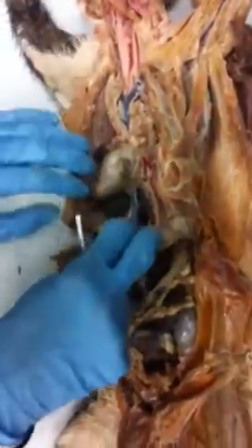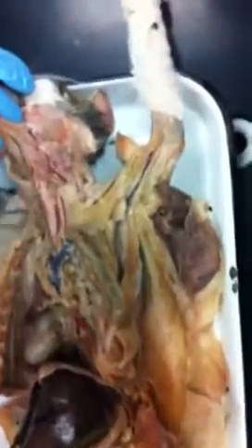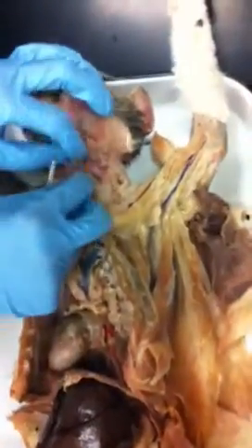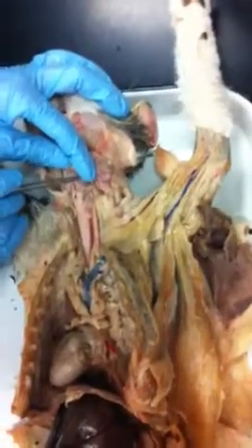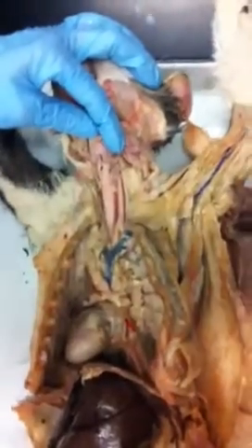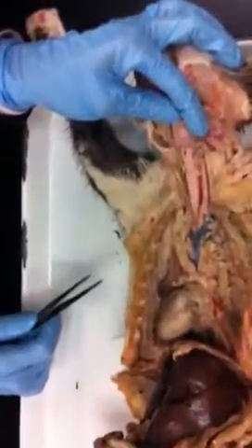Now, if we look at respiratory structures. So again, here's the trachea. This big bump here, this big cartilage here, these big plates right here and right here. Those are the thyroid cartilages, and those correspond to these right here. Thyroid cartilage. The bump on the front, that's the Adam's apple.